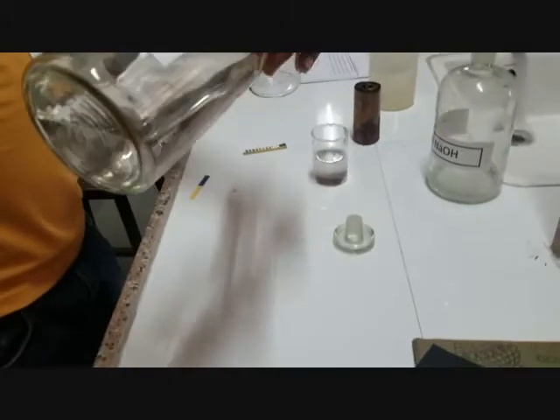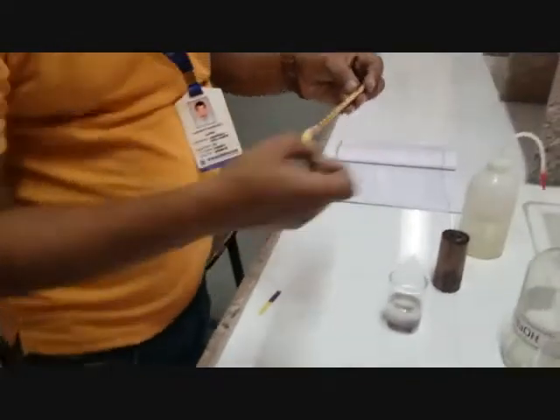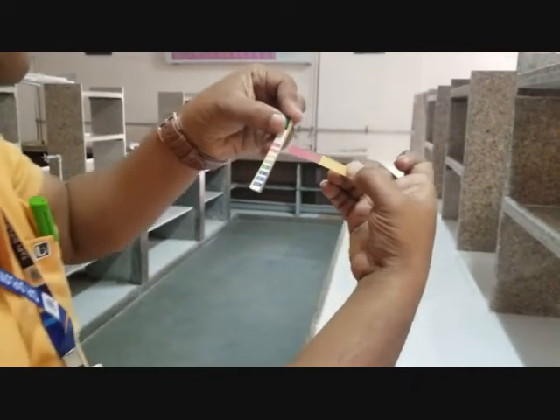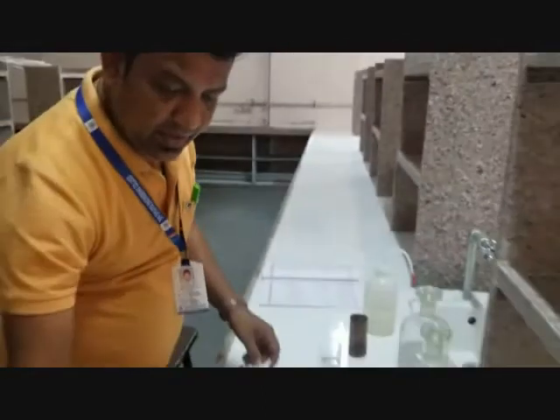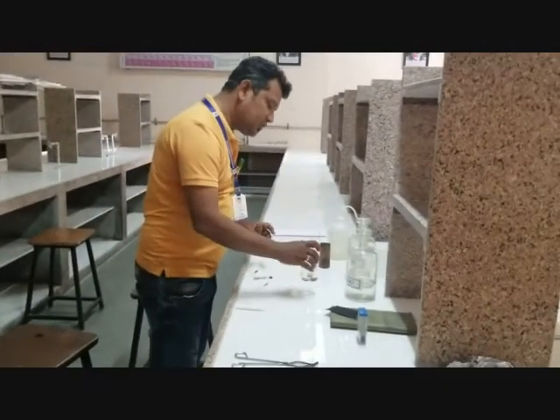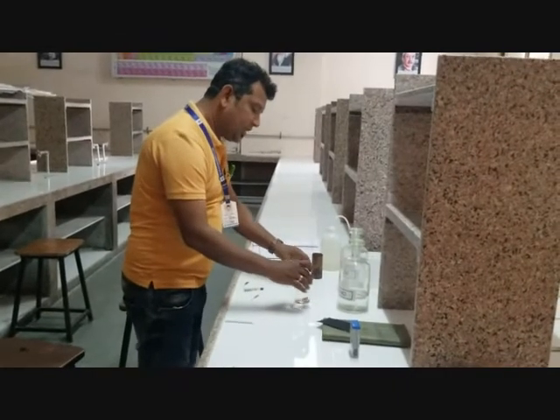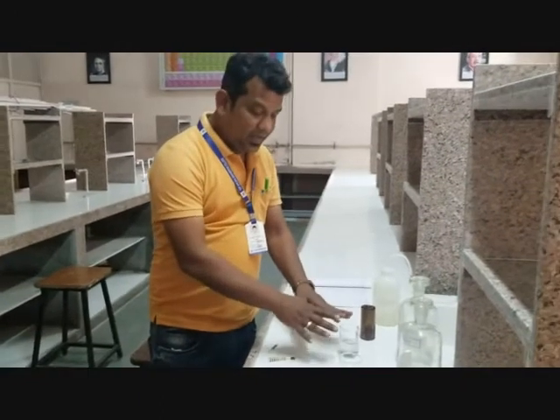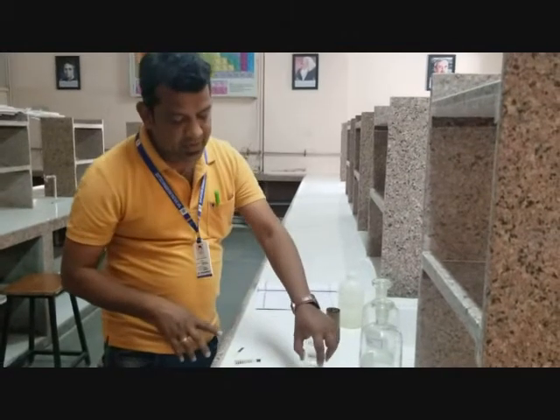In the second beaker we take acidic medium, meaning the acid solution, and again measure the pH of this acidic medium solution, which is between 2 to 4 — a pH of 3. We dip our second foil strip in this solution. So we are performing corrosion of this copper strip in basic medium with pH 10.5 and in acidic medium with pH 3.